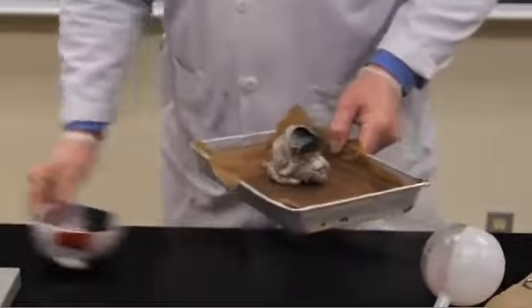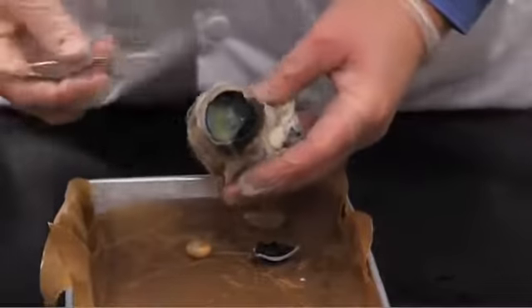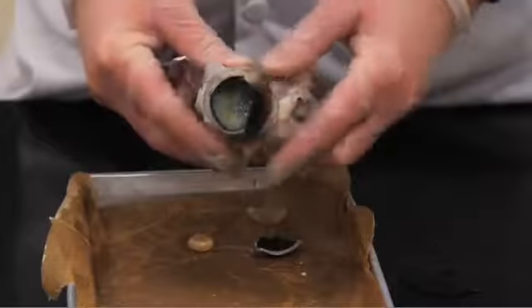Yeah, and as we finished this, we dissected a cow eye. The cow eye, can you zoom in on that? Yeah. Okay, the actual cow eye structure is easy to determine. It's encased in fat, so this really looks kind of crude.